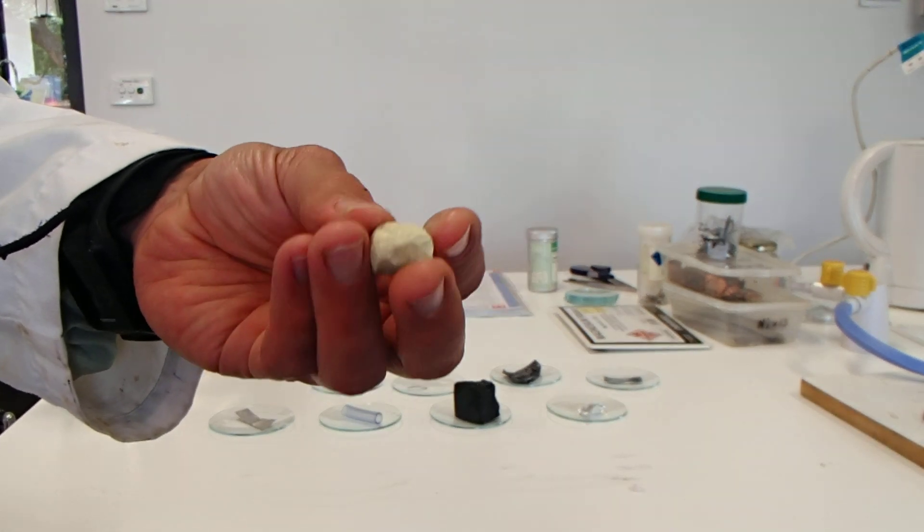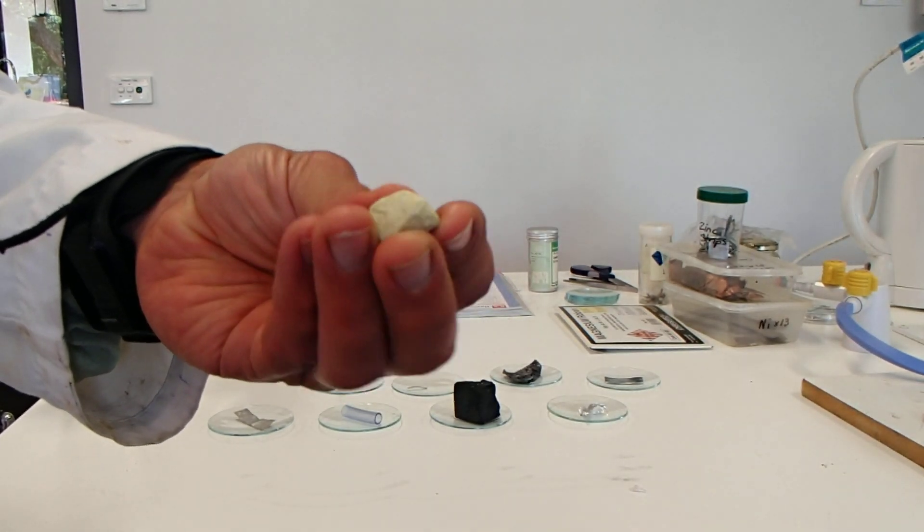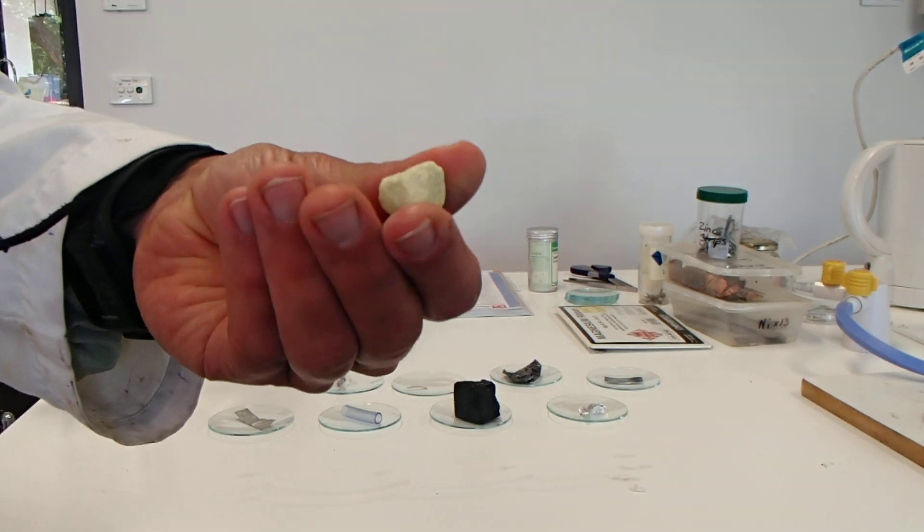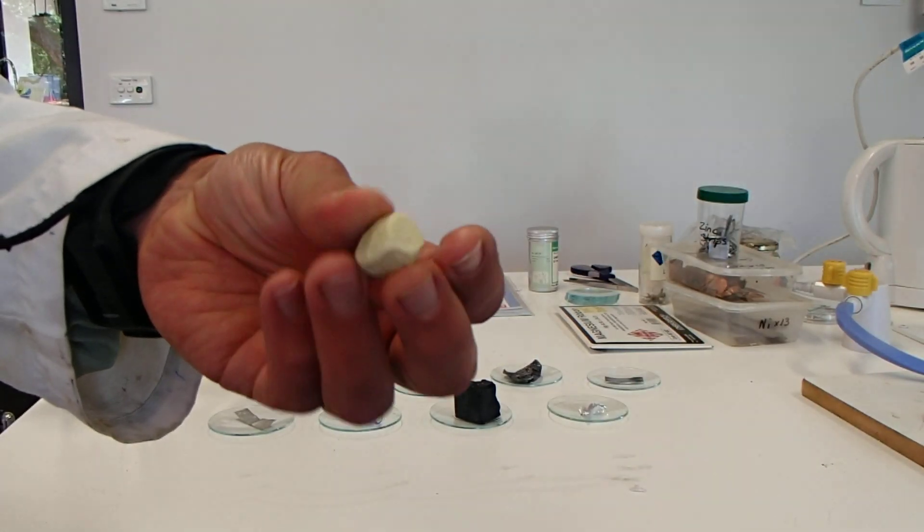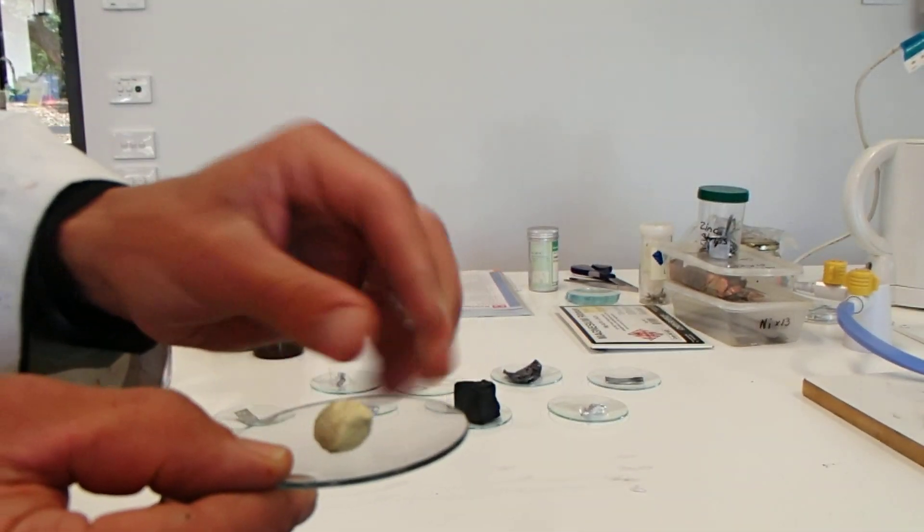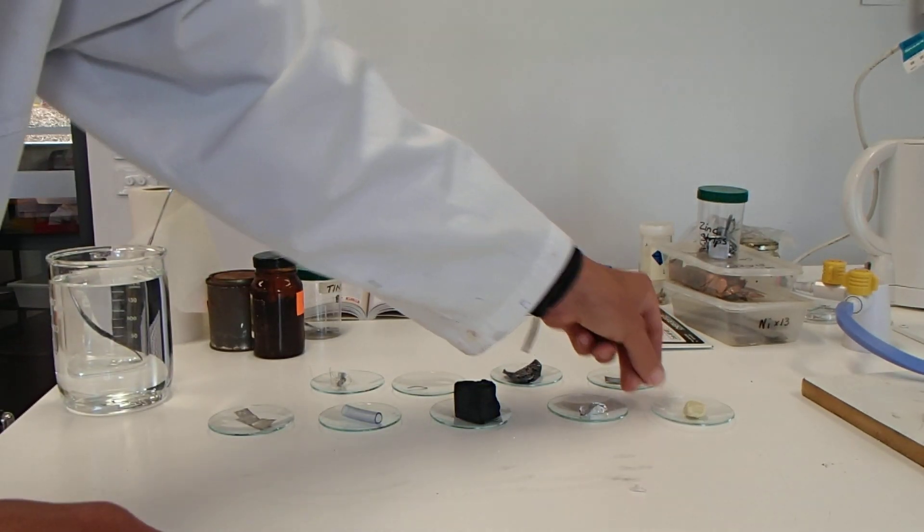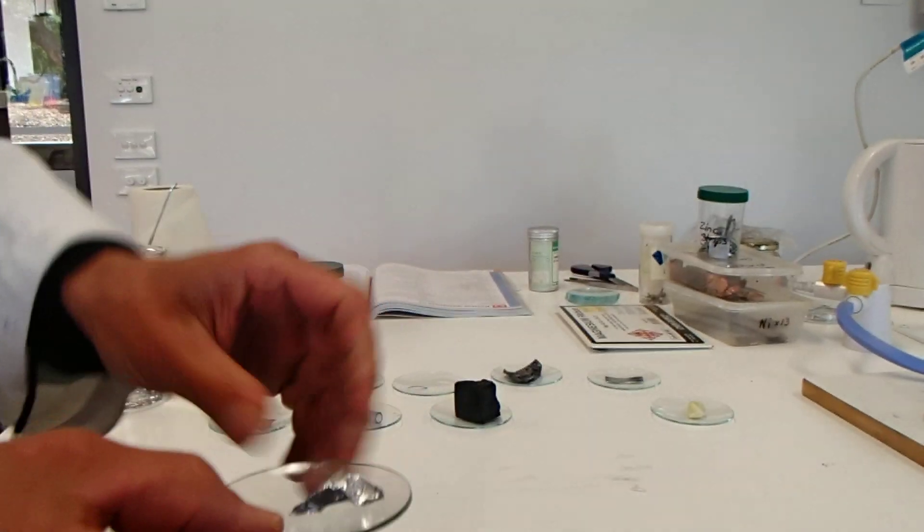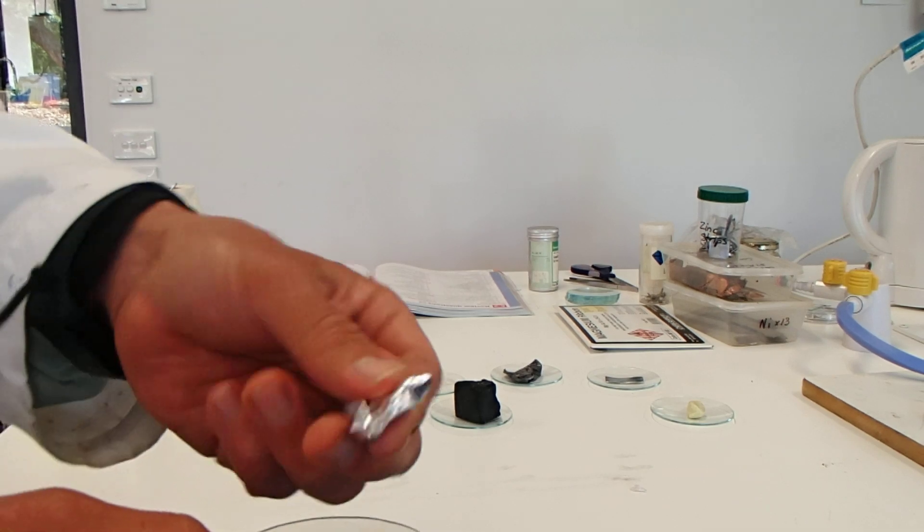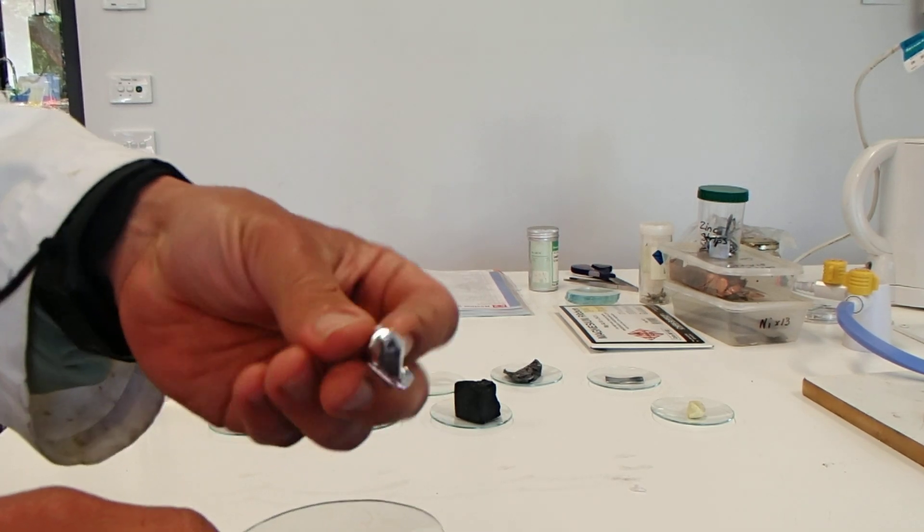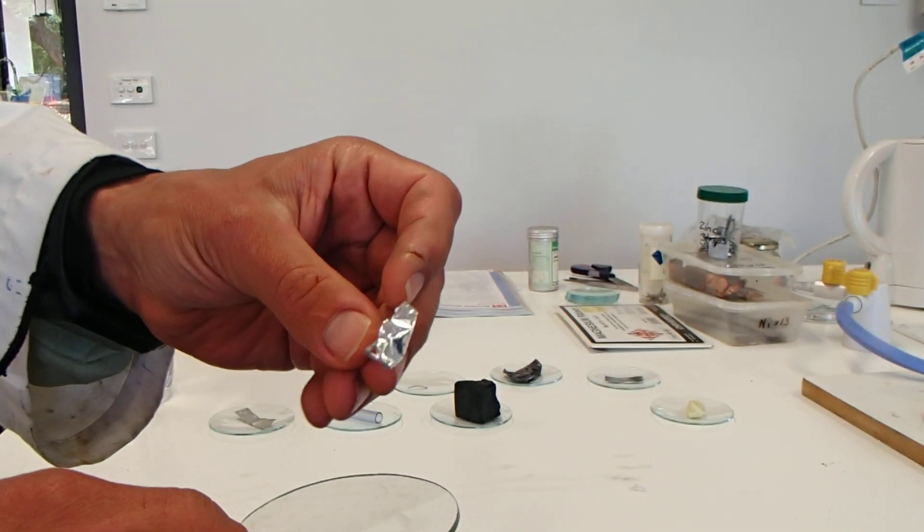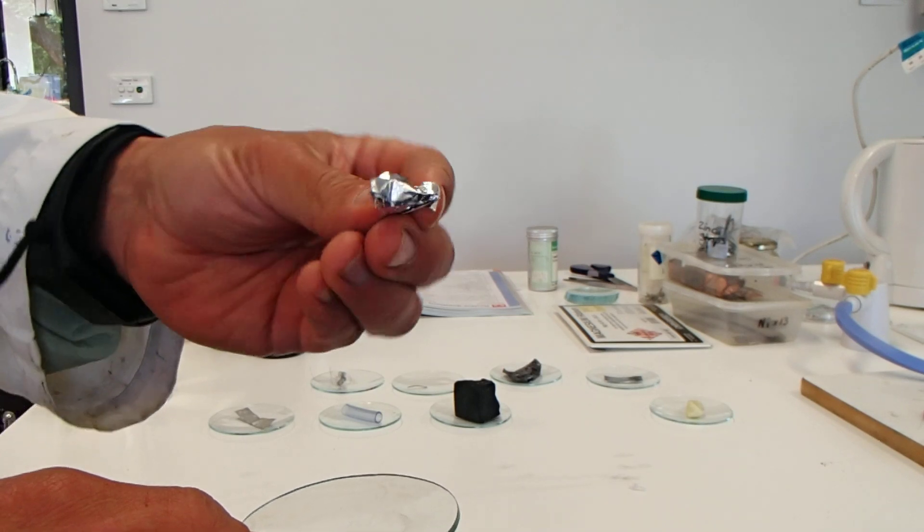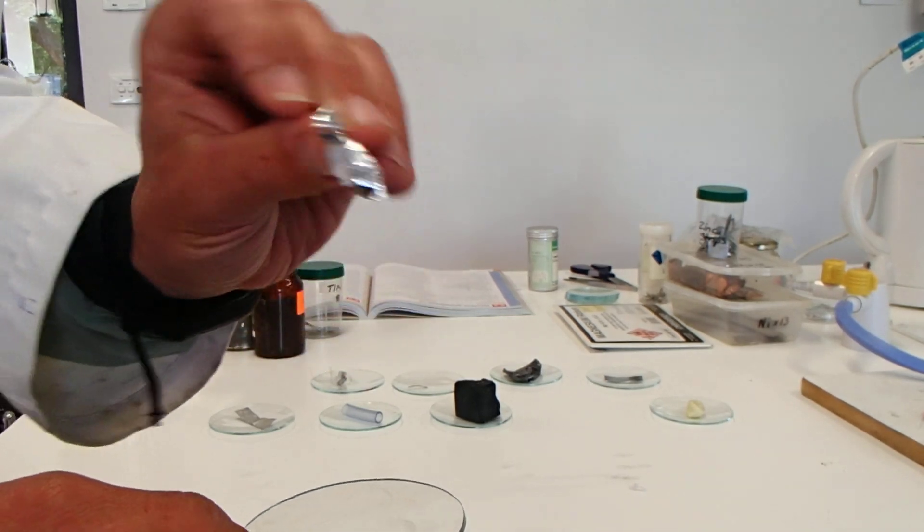You should be writing these appearances into the table that you've created in your workbook on your computer. Sulfur is dull, it's not shiny, feeling dusty, quite light. Aluminum—we're all familiar with this in the form of foil—shiny, light, bendable, silver in color.